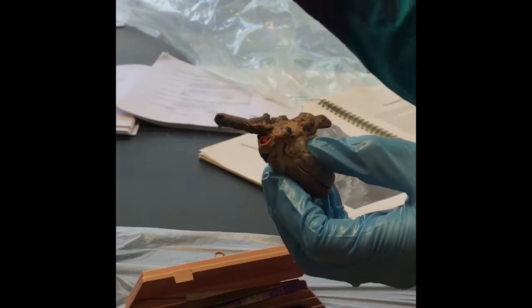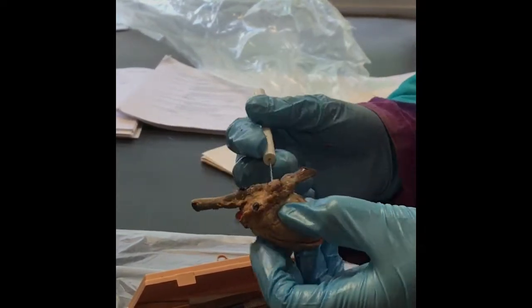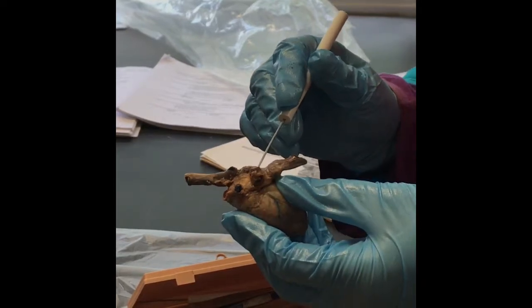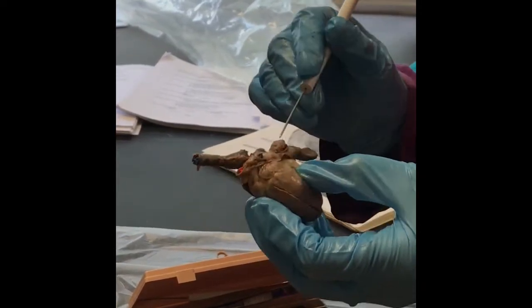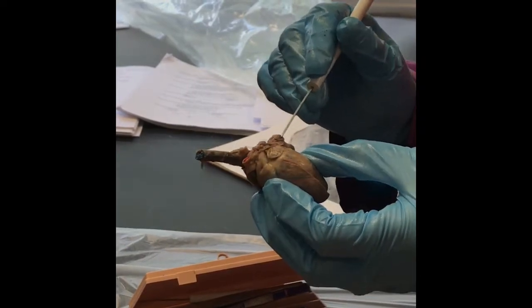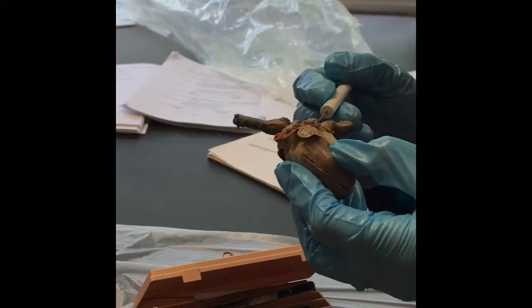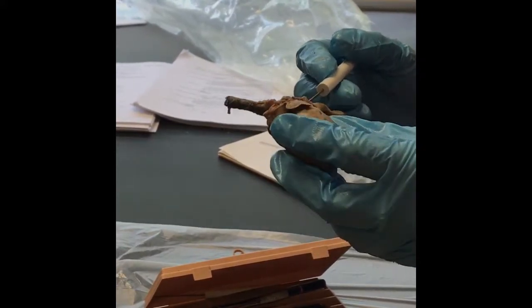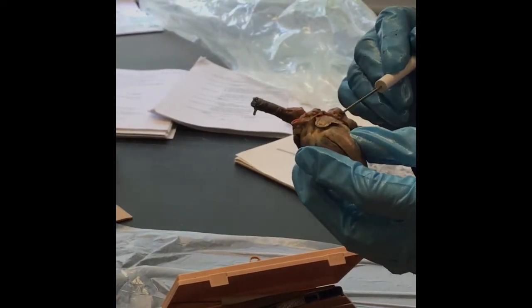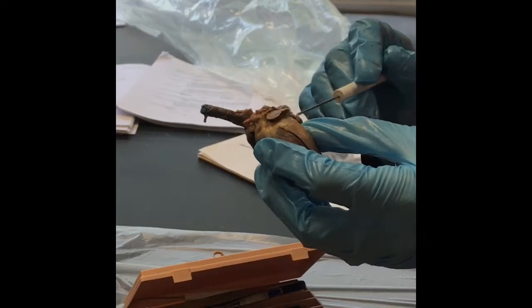From the lungs coming back to the heart, it's coming back by way of pulmonary veins. Right here, here's the right pulmonary vein. Here is the left pulmonary vein. If I would keep going, and I'm going to do this, look what I'm picking up with my probe. The left atria. So all oxygenated blood from the lungs is dumping back from the pulmonary veins into the left atria, right here.